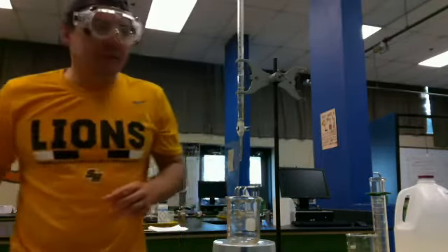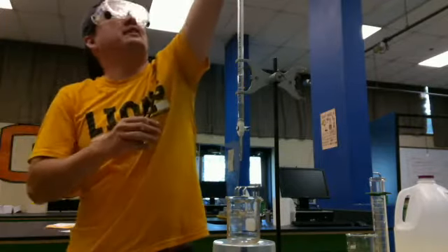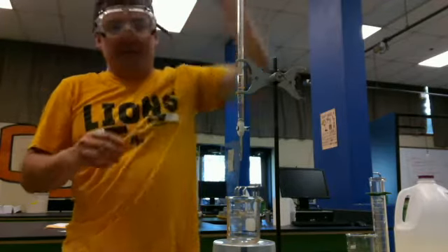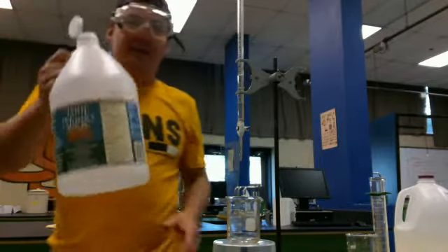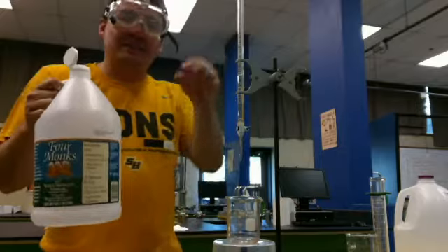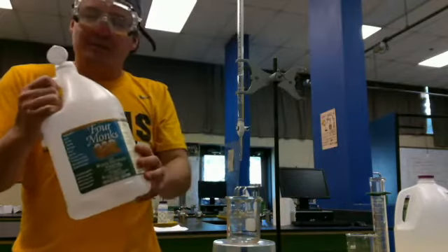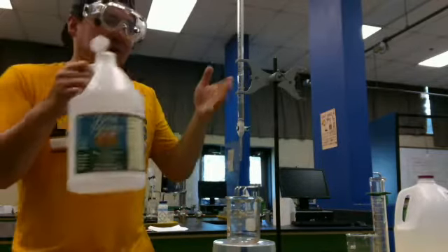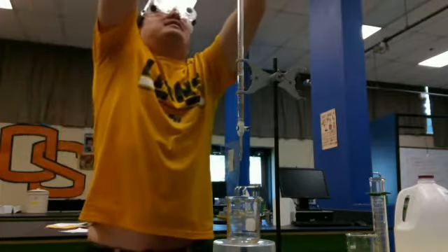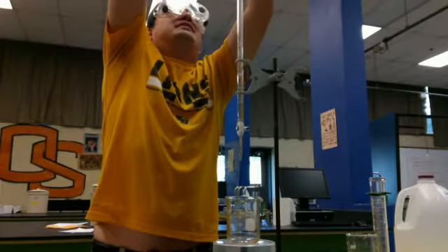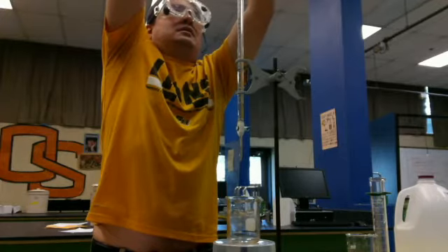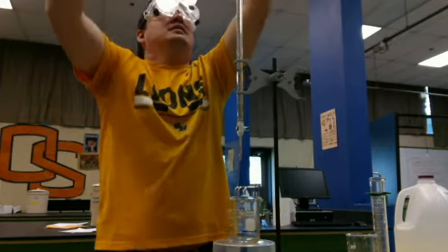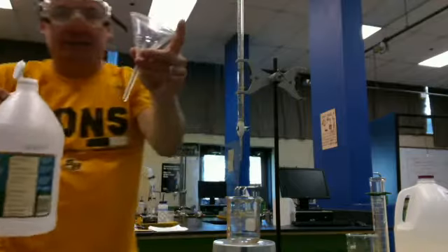So here's how a real titration works. Now, you might not be able to see a lot of this, but it's off camera, but bear with me. I have vinegar. So imagine instead of dropping with a pipette, you're going to use a burette, and I'm just going to top this off. I've already got some in there because I was setting up.